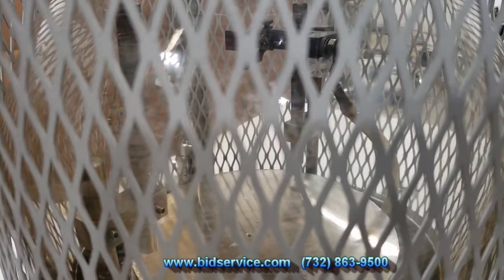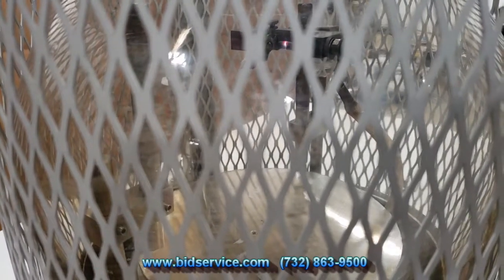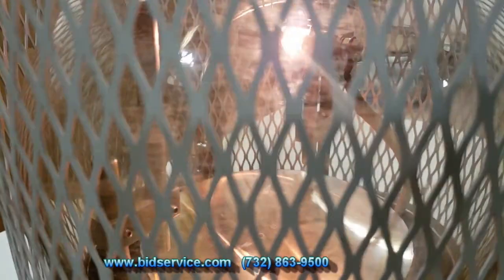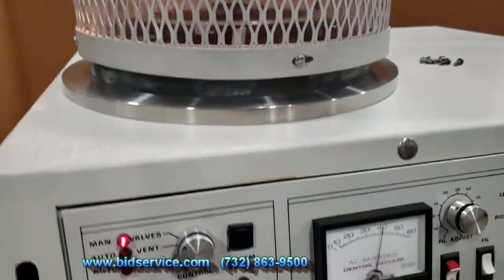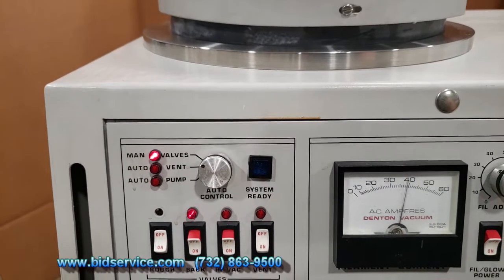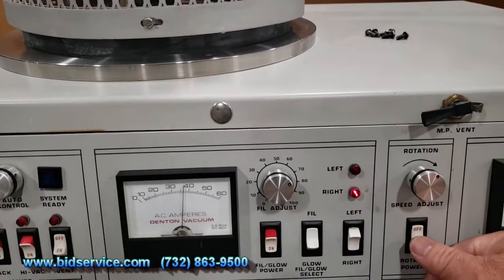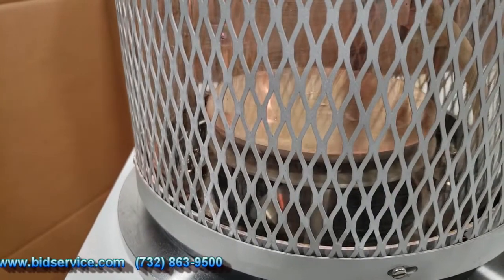There you see - that means the voltage is going to it. And you can see it's getting glowing - there you go - and now it will be evaporating the carbon rod. You can see that we're up around 35 to 40 amps with that.